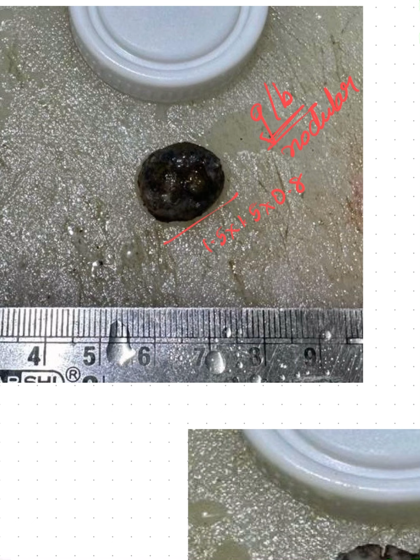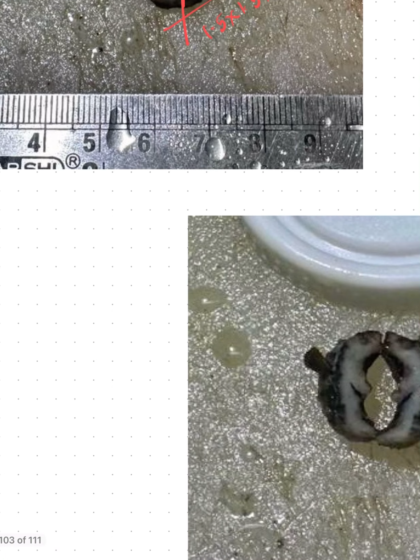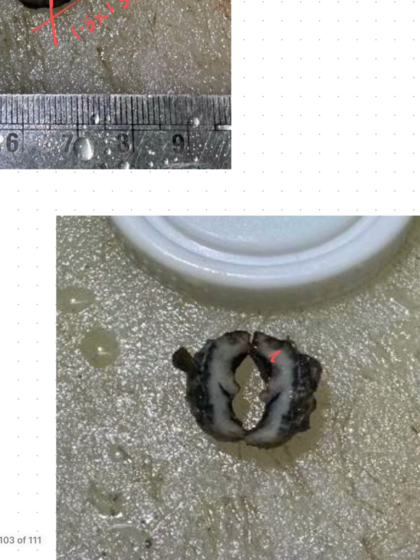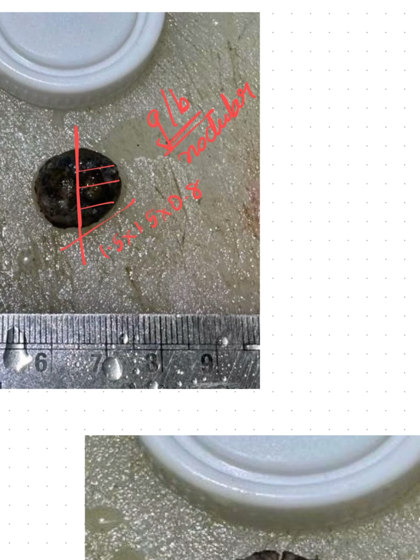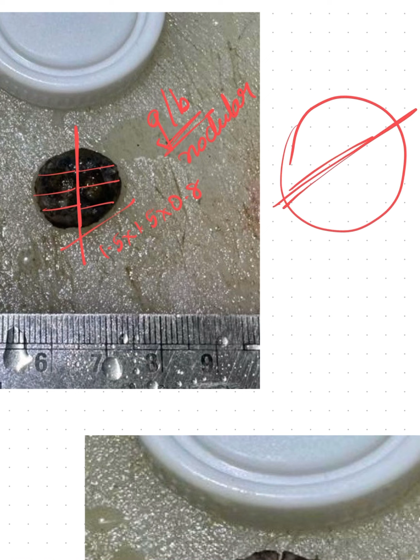We have cut this specimen into two halves like this, and the cut section shows gray-white color. Each half was divided into four bits. So this is the lesion we have cut into two halves, and in each half, four bits were given, 1, 2, 3, 4. A total of 8 bits were given for microscopic examination.